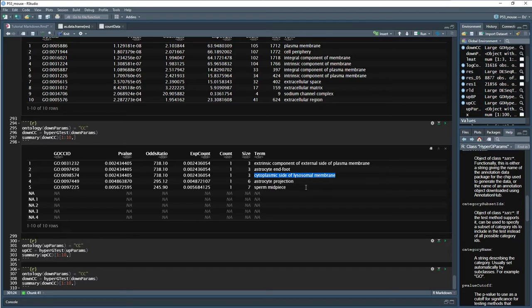lysosomes are higher in the P53 minus. Nothing too sticking out too much here. We have to do molecular function. All right, and then we'll do the same for down while that's running.